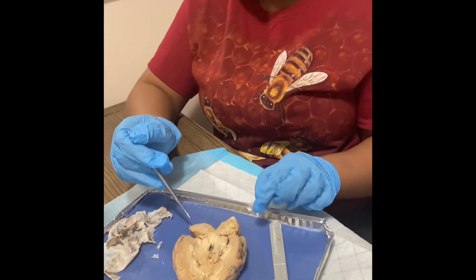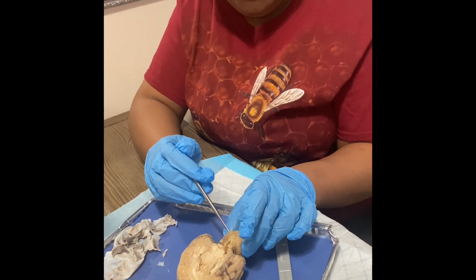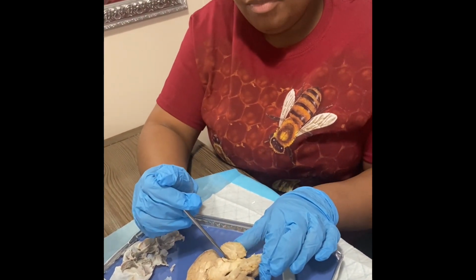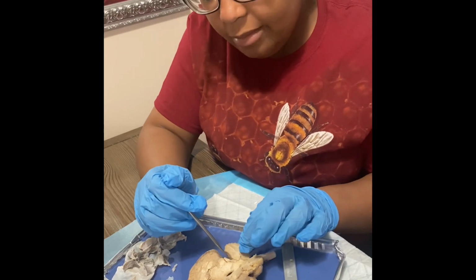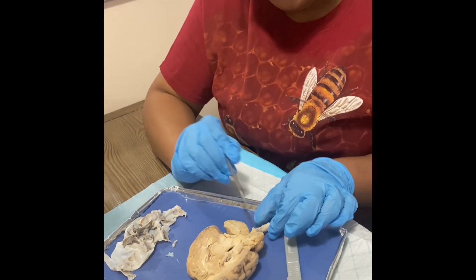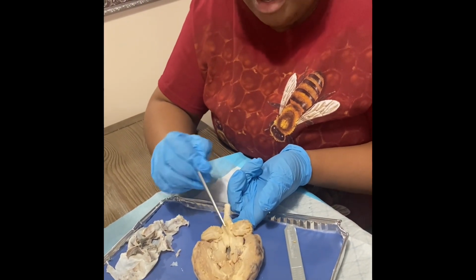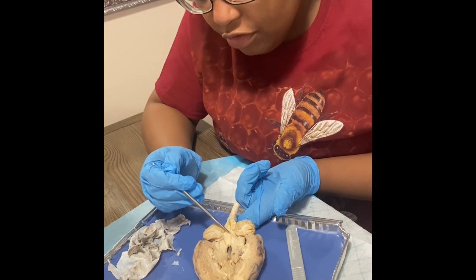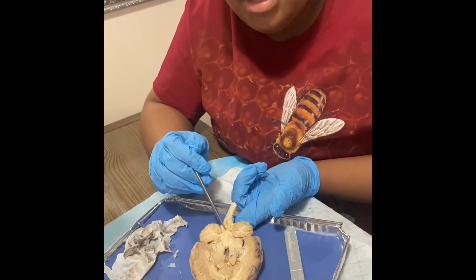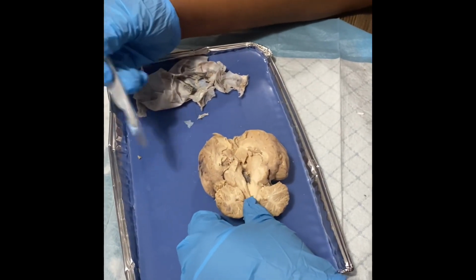And then we'll go to the cerebellum right here, which is, as I said earlier, the small brain. And right here we have the cerebral aqueduct, which is right here. And near the spinal cord, we have the fourth ventricle, which is right here. And you can also tell it's a ventricle because it has a little space in this area for the blood vessels to be able to flow through. Now I will make 2 frontal cuts.